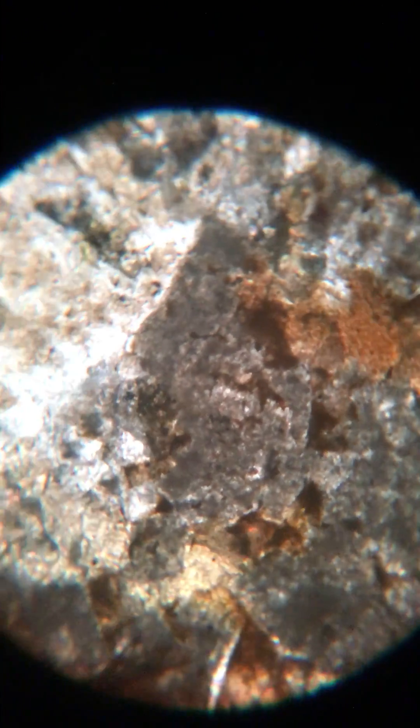This rock is completely crystalline. In cross-polarized light, sometimes depending on the diagenesis you won't see the classic interference colors — lots of overprinting is going on. In some sections we do see some interference colors.